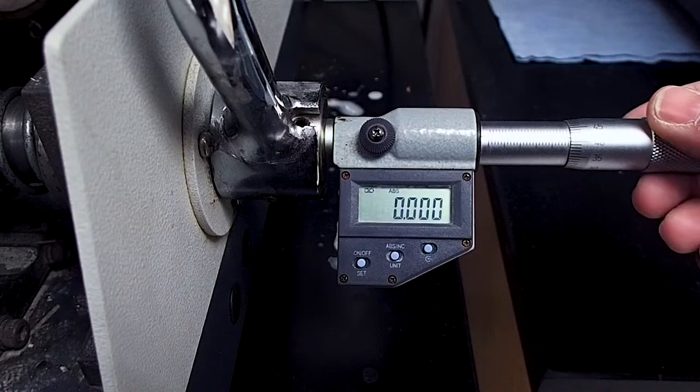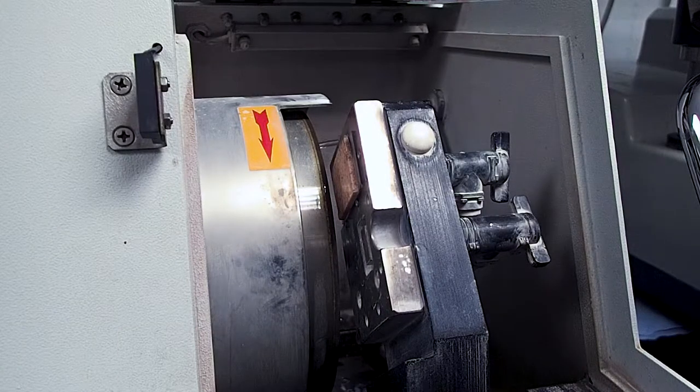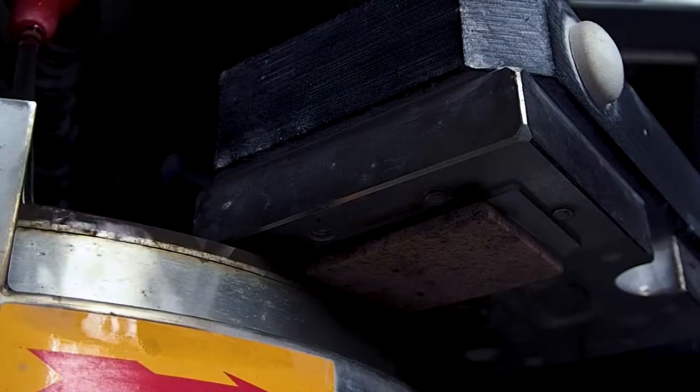Next, I want to make sure that my slide is clear of the grinding wheel before starting, so I'm going to turn on the micrometer and move the vacuum chuck away from the grinding wheel. Recall that when I frosted these slides earlier, I set the micrometer to zero at the point that the slide was in contact with the grinding wheel. I can now use this micrometer as an estimate to determine when I'm approaching a thin section thickness of 30 microns. If you're unsure whether the micrometer was set to zero during the frosting stage or have concerns that the settings may have been altered, you can advance your slide so that the glass is in contact with the grinding wheel, not the rock, and set the micrometer to zero at that time.